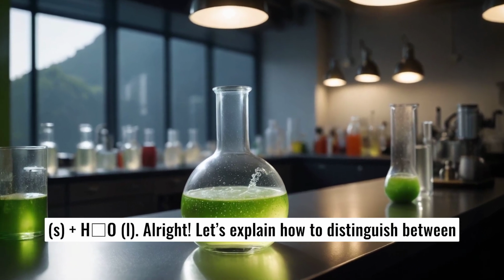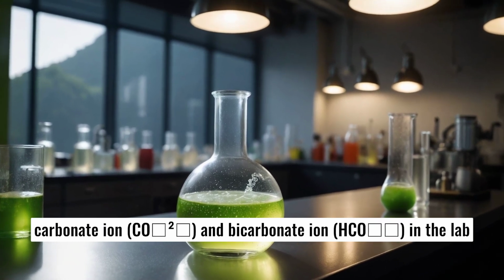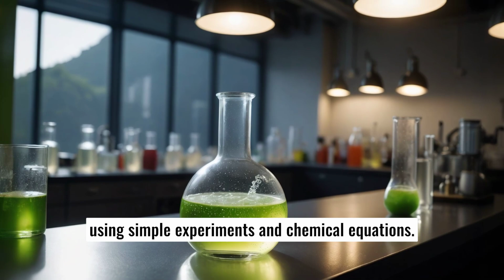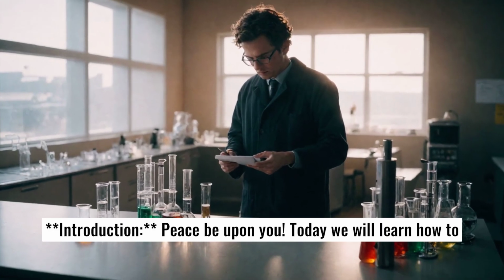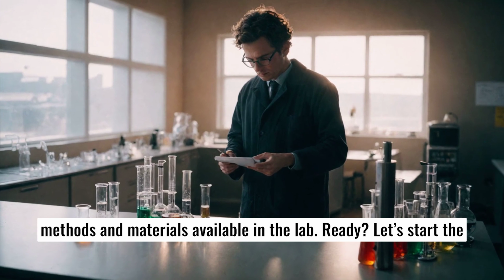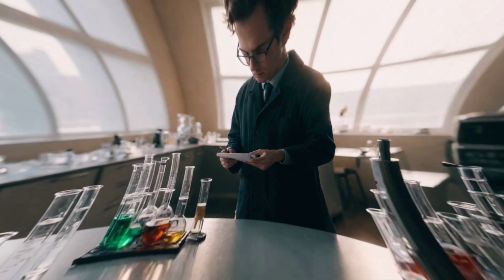Alright, let's explain how to distinguish between carbonate ion, CO3 2-, and bicarbonate ion, HCO3-, in the lab using simple experiments and chemical equations. Introduction. Peace be upon you. Today we will learn how to distinguish between carbonate and bicarbonate ions using easy methods and materials available in the lab. Ready? Let's start the experiments.